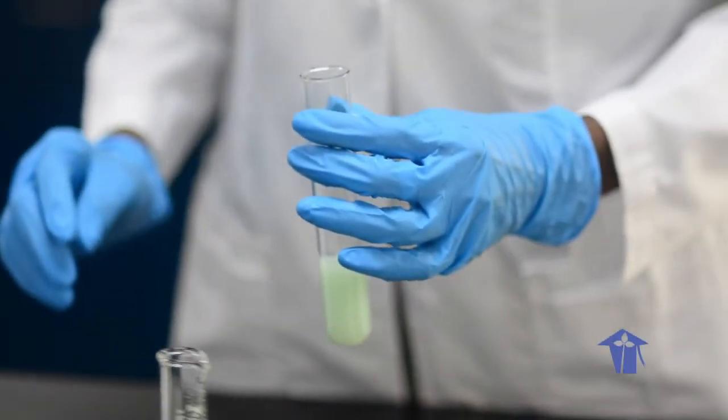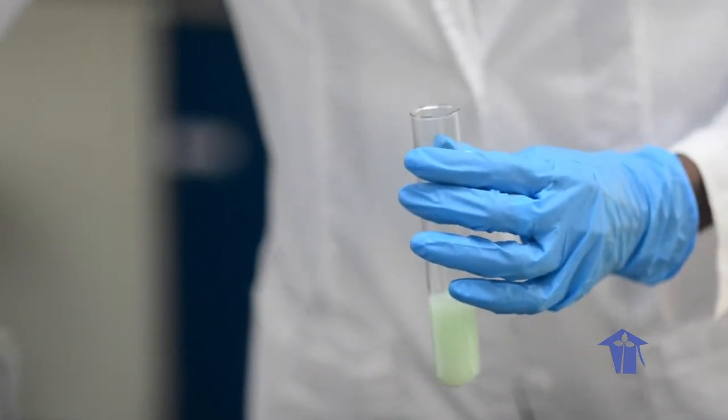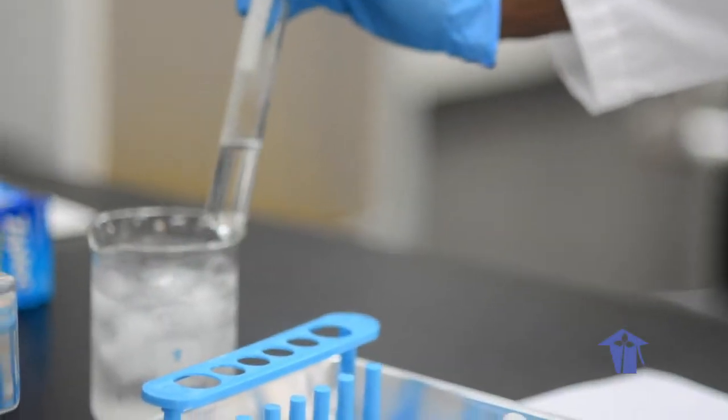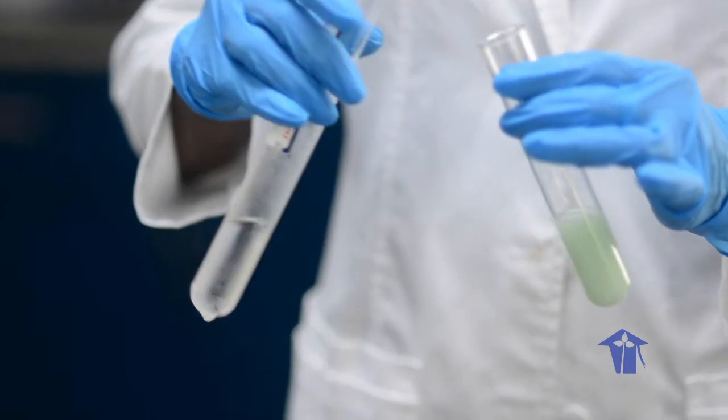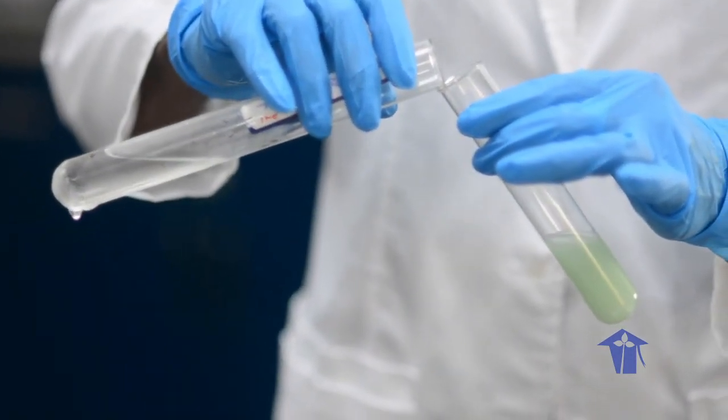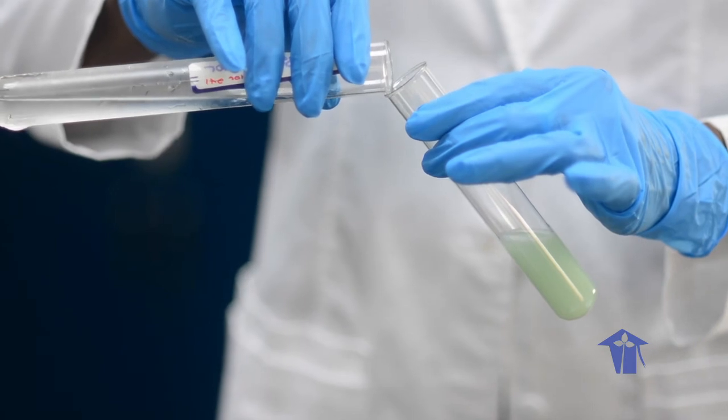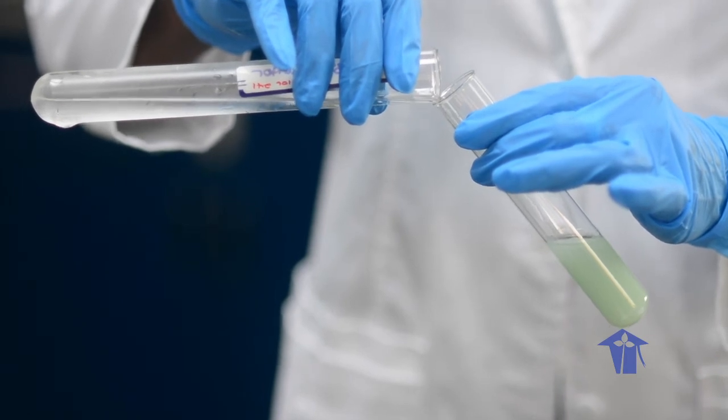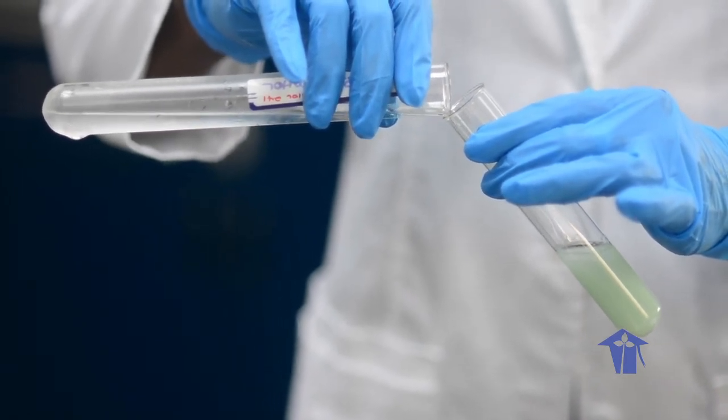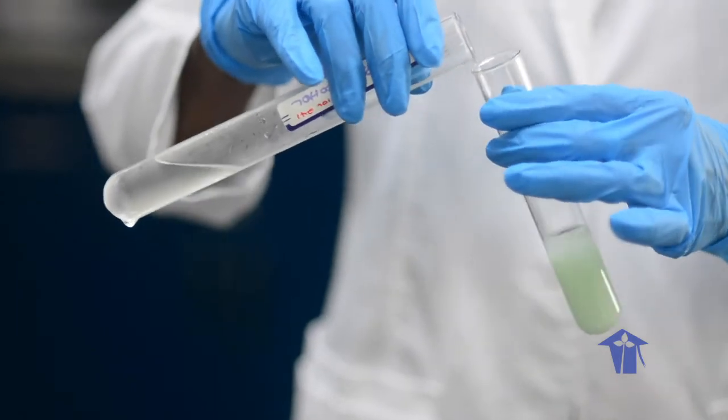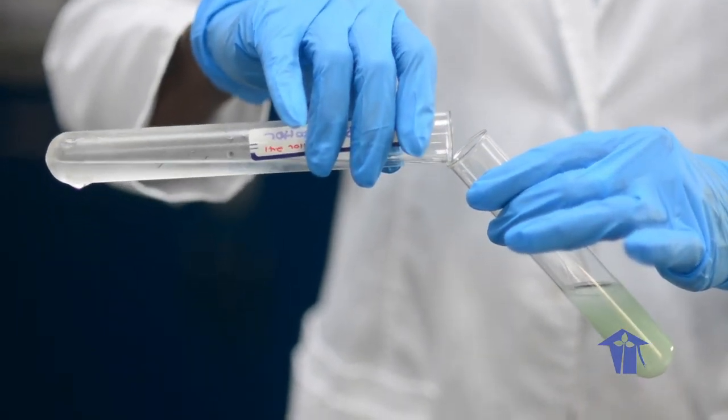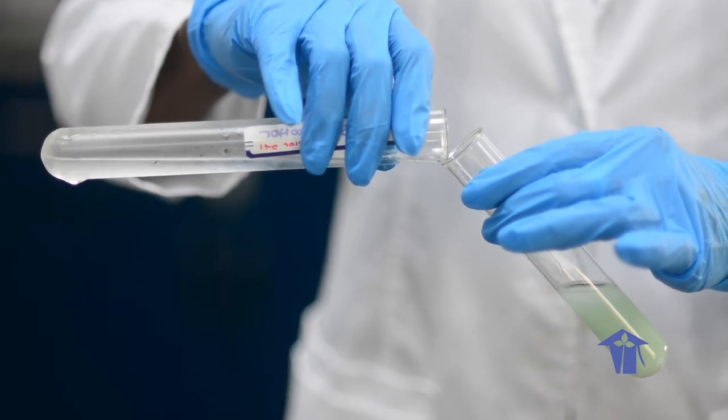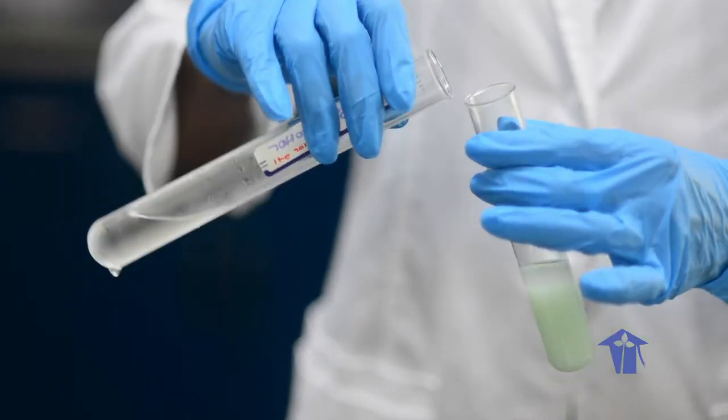And then, my isopropyl alcohol that was chilling in the water bath. I am now going to slowly add the alcohol to the mixture containing the banana. So, I am slowly pouring it into that mixture. Put that there.